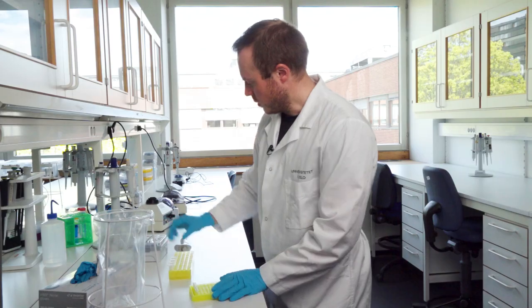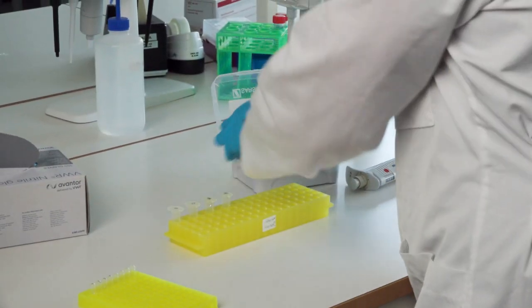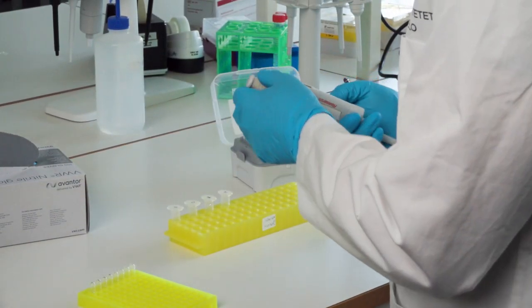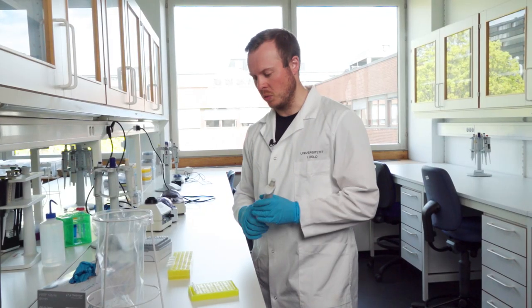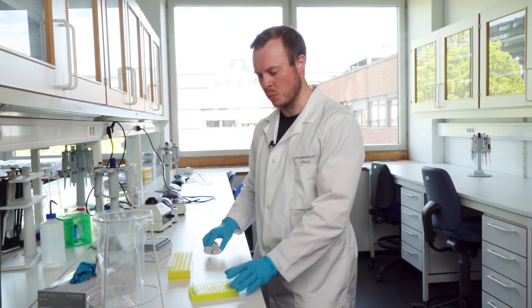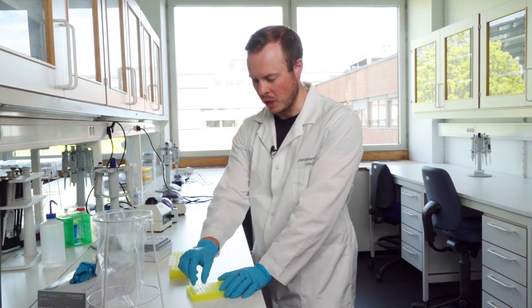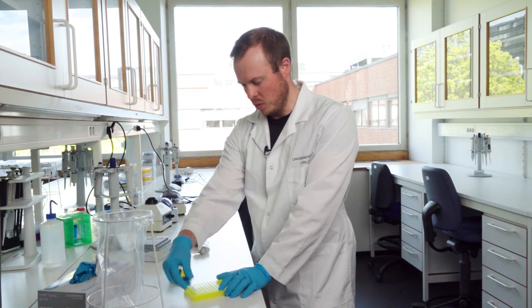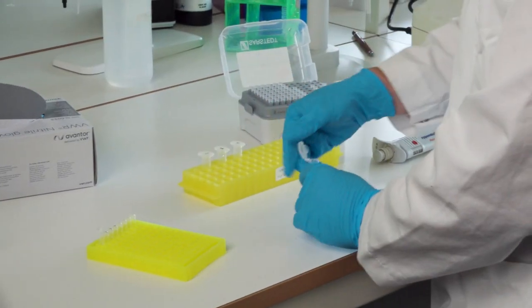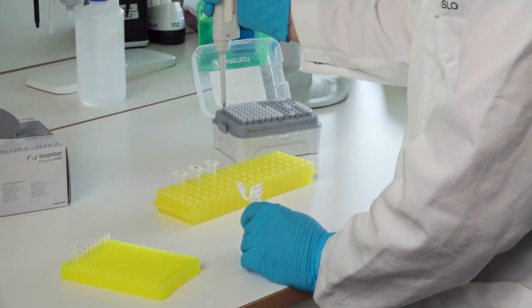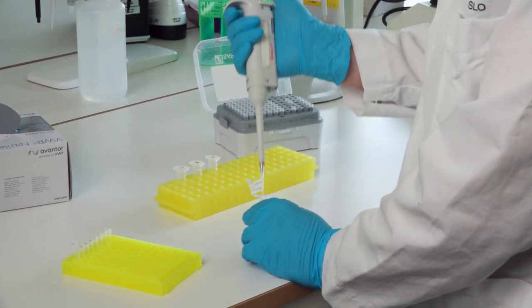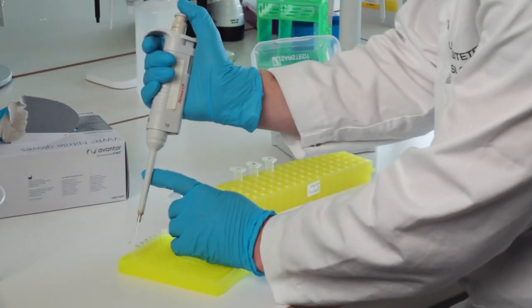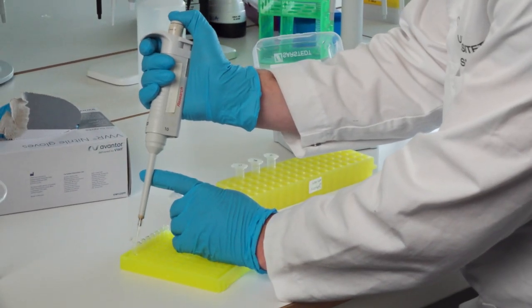Then it's opening the pipette box. Here we use two microliters of sample, so the total volume is 20 microliters per reaction. Open the first PCR tube, take a part of the sample, add it to the tube.